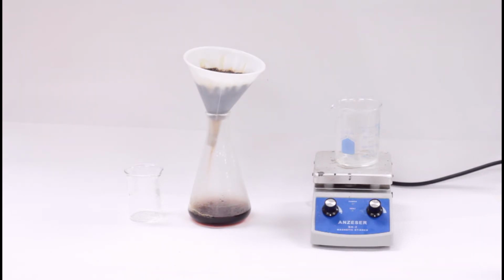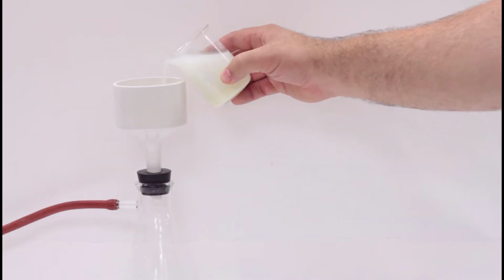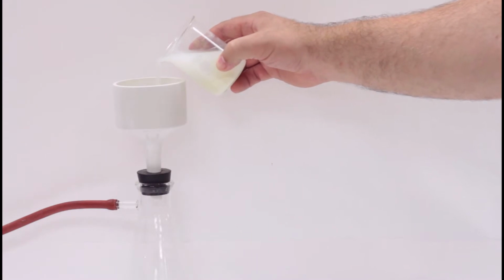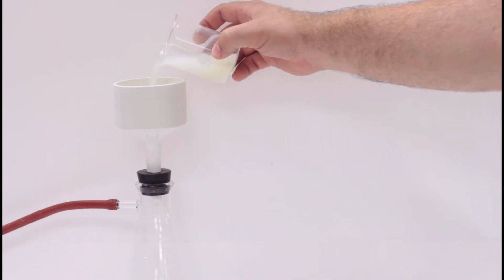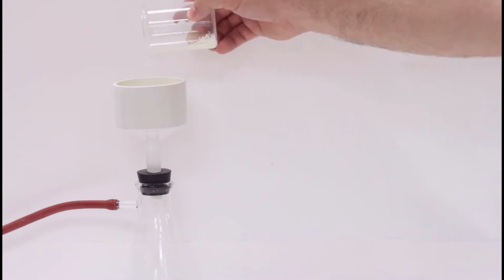In this lab, we will be using a vacuum filtration to perform a gravimetric analysis in order to determine the concentration of an unknown solution using a precipitation reaction. For the discussion section of this lab, you'll tell me how gravimetric analysis works and how vacuum filtration works. I'll provide some sources, but you'll need to do some digging around for yourself as well.